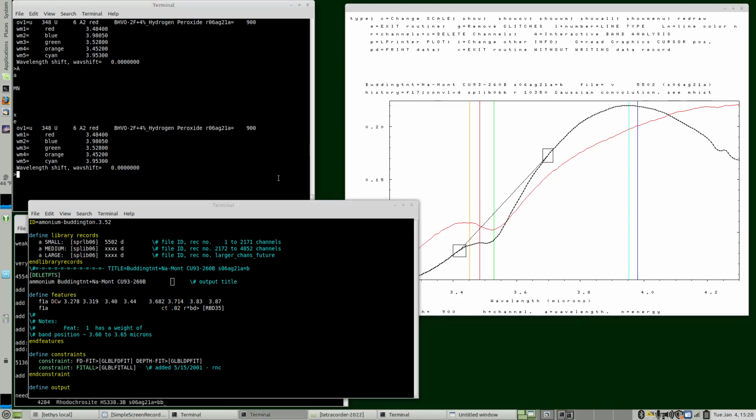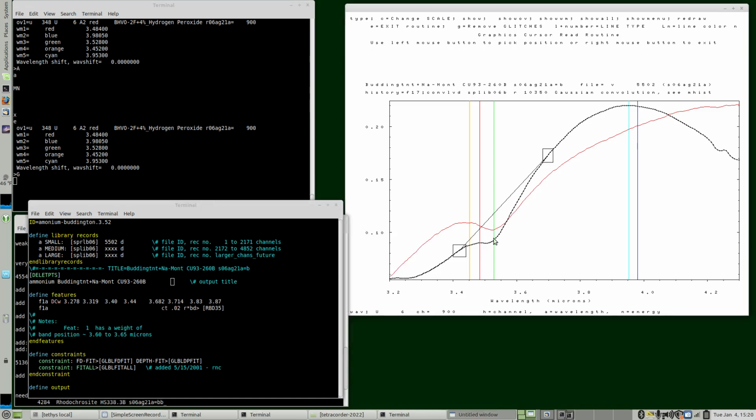So then for the curved continuum, if we do a capital G we can read the graphics cursor positions, and we can make this a little smaller. So that's the 3.42, and that's 3.4 to 3.44. So 3.42 is right in between, and then around 3.7, and that's 3.7. Okay, so that looks good. So now the other one, 3.83 to 3.87, so about 3.85. So that's right about in there.